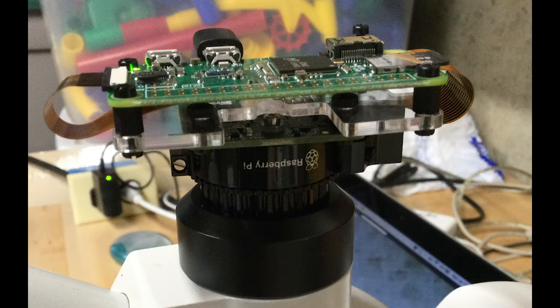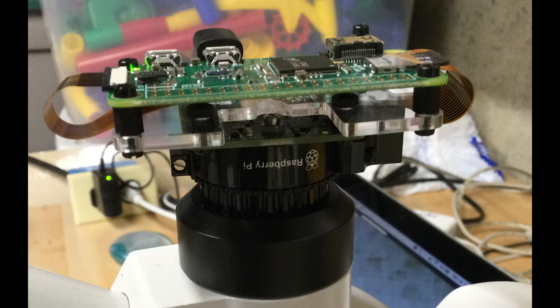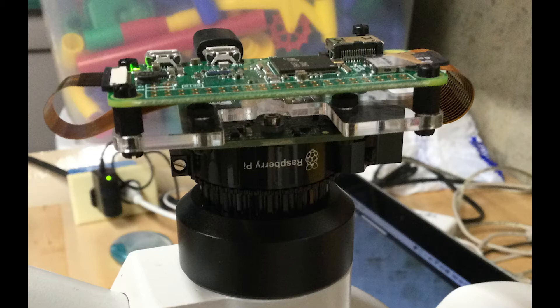The lens mounting that is equipped on the microscope has a little bit of lens in it such that it acts like an eyepiece lens. The image the Raspberry Pi sees is very much what you would see with the eyepiece lens, but with a slightly smaller field of view.